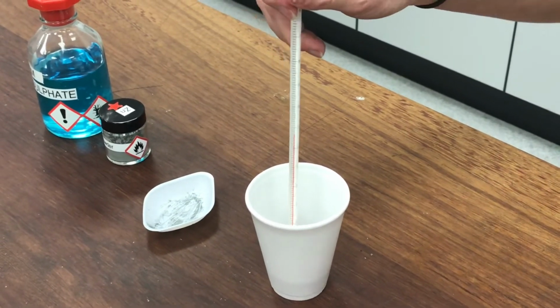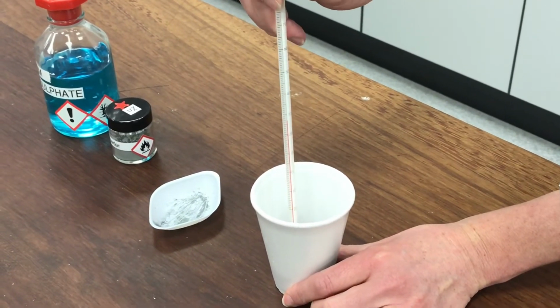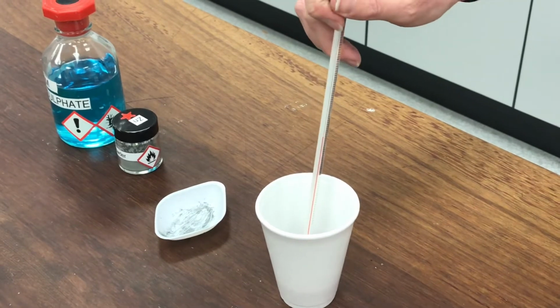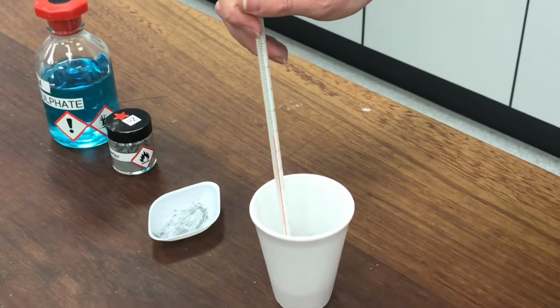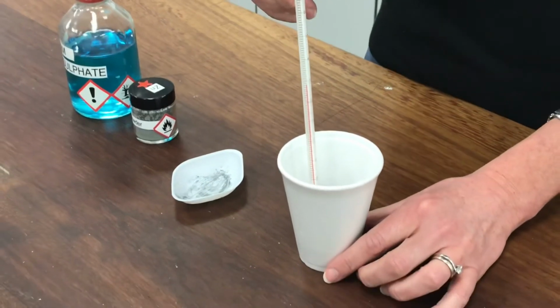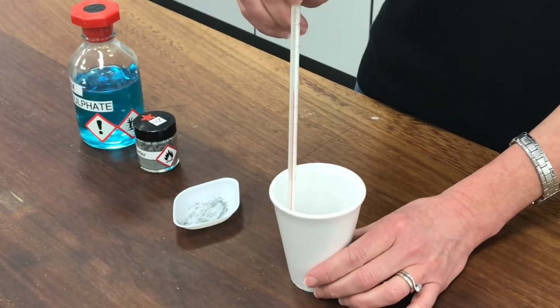At the moment, I think that's on 27. I'll look again in a minute and see if I think it's changed to anything else. You see if you can read it off the screen as well. I think it's crept up a little bit beyond there. I think it's on 28 degrees C. I hope you agree with me. I'm going to stop there and record my data in my table.